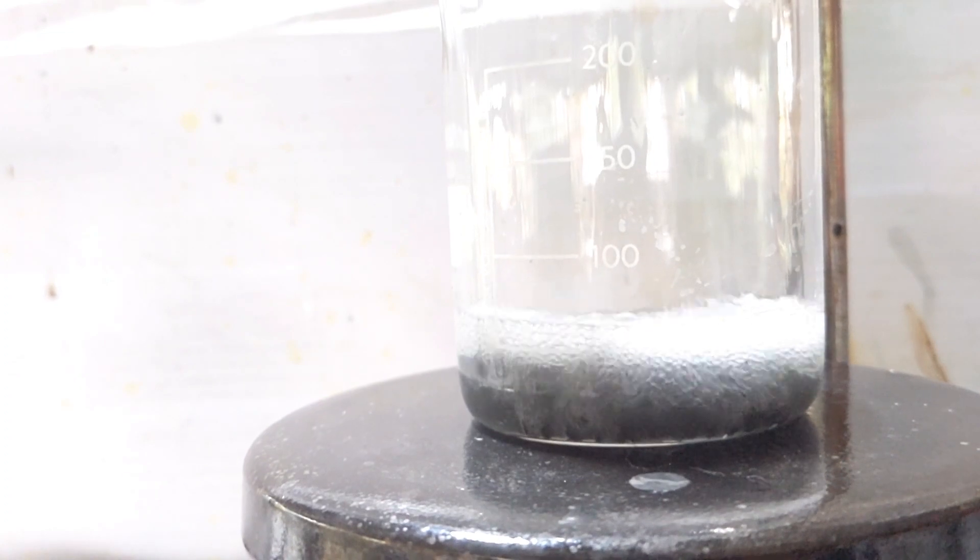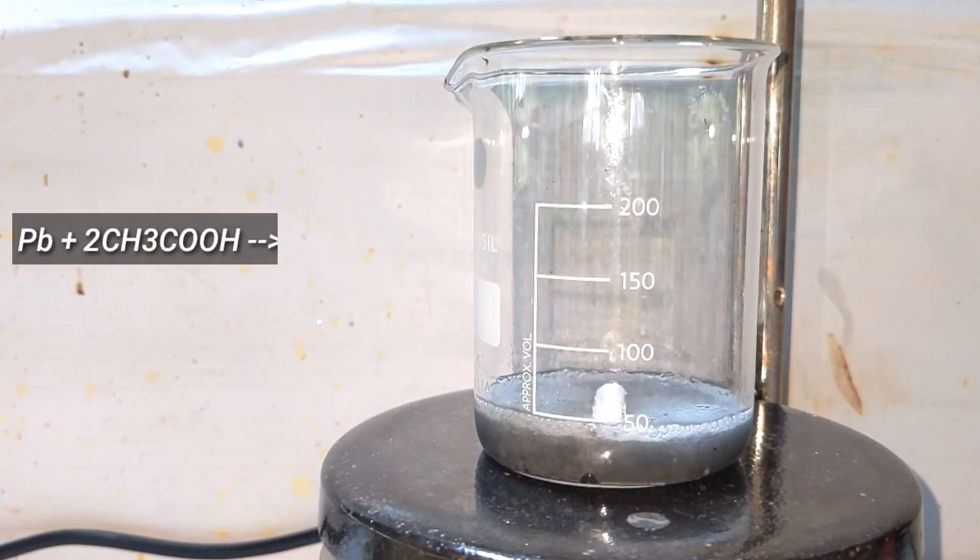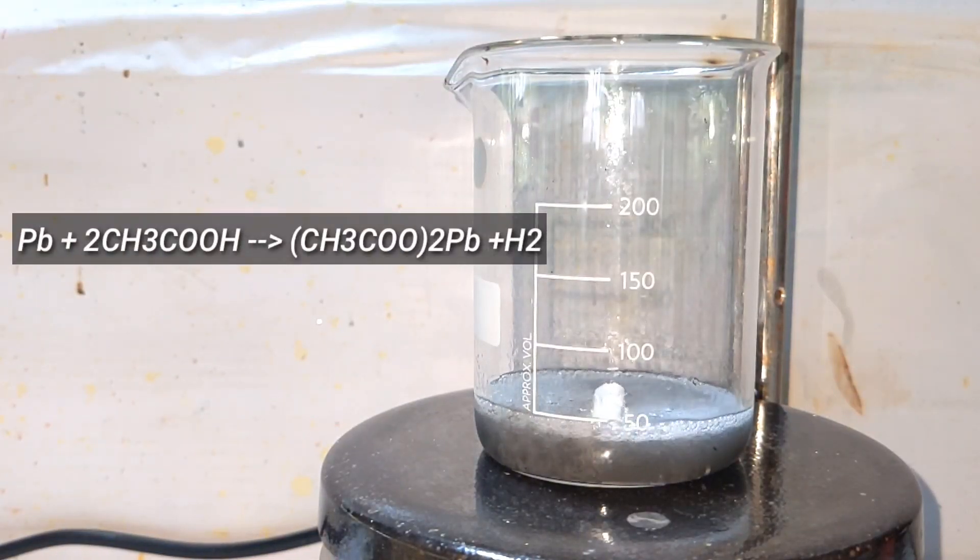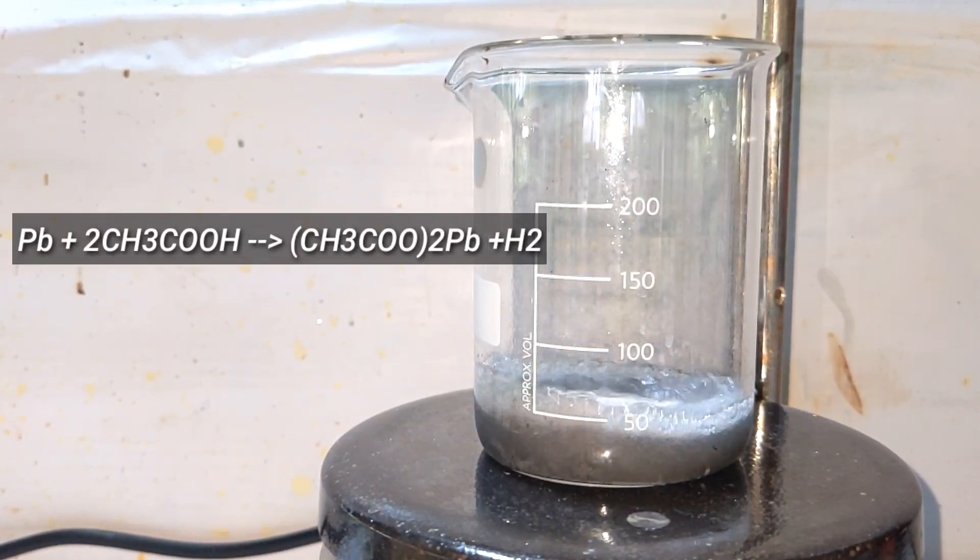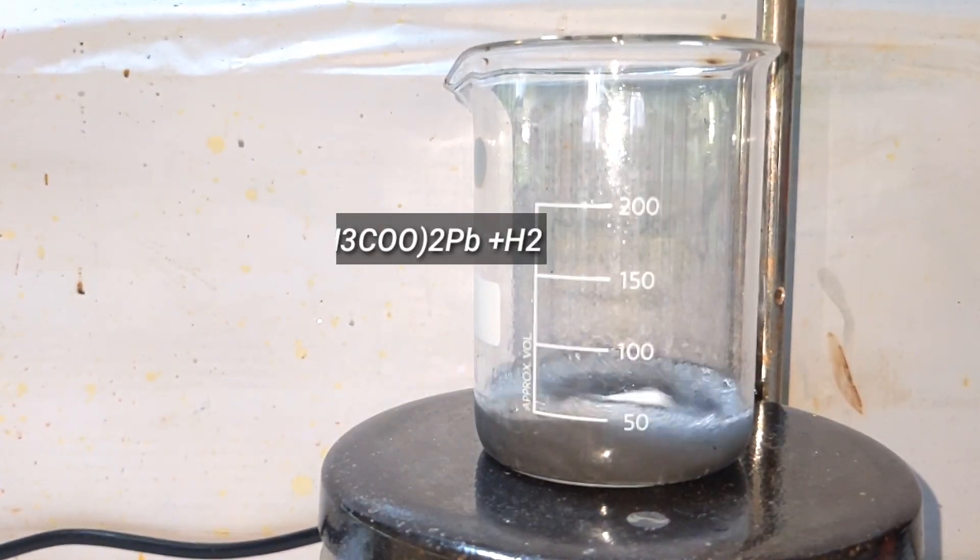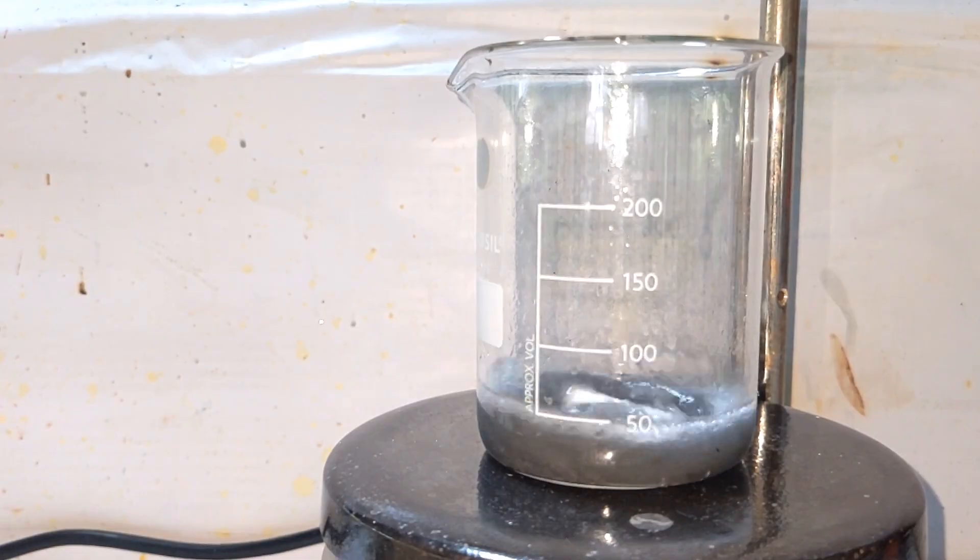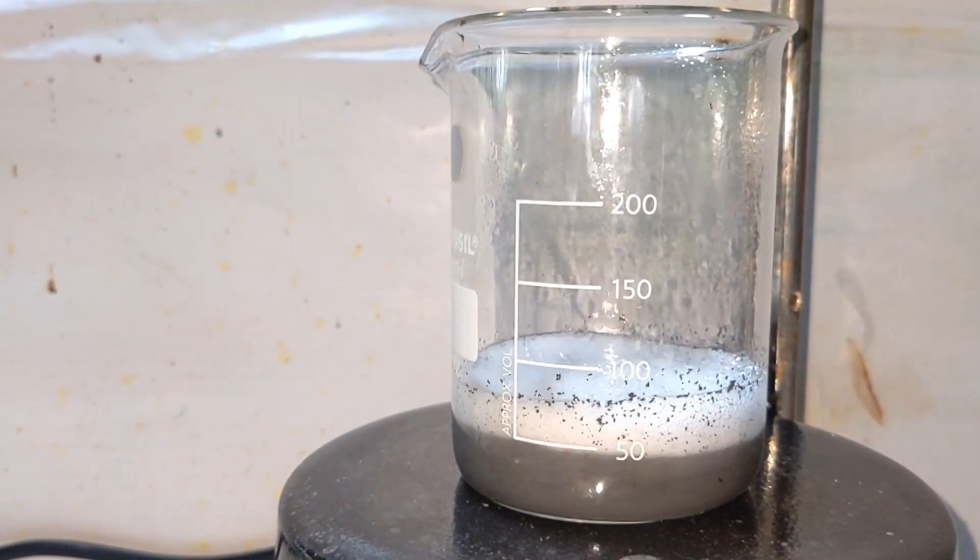What is happening here is the direct combination of lead metal with acetic acid forming lead acetate and hydrogen gas is being released. The reaction is extremely exothermic and the contents of the beaker is boiling right now.